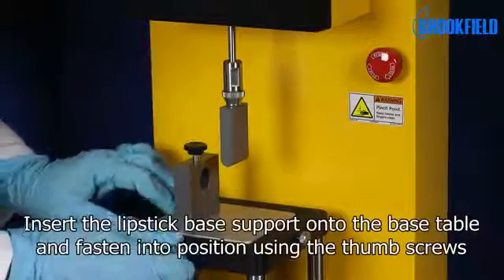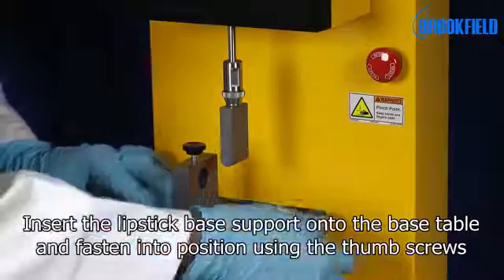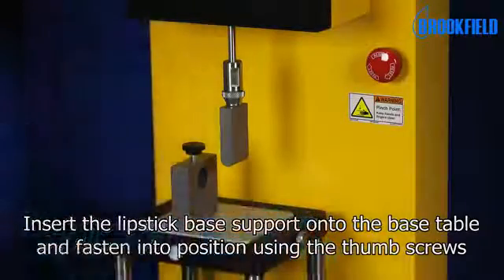Insert the lipstick base support onto the base table and fasten into position using the thumb screws.